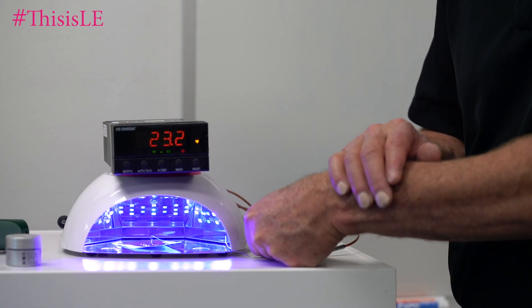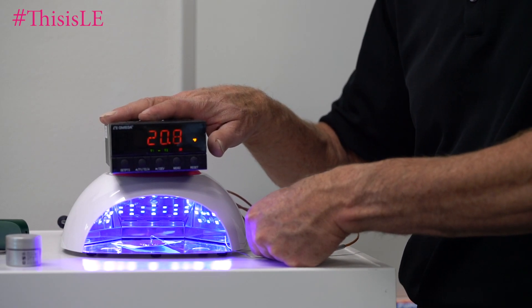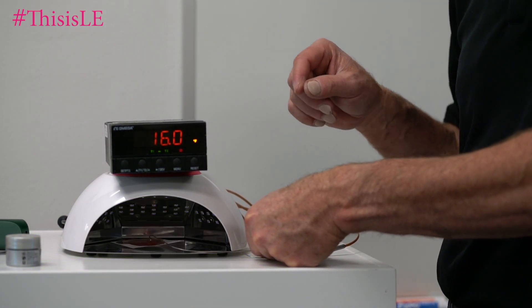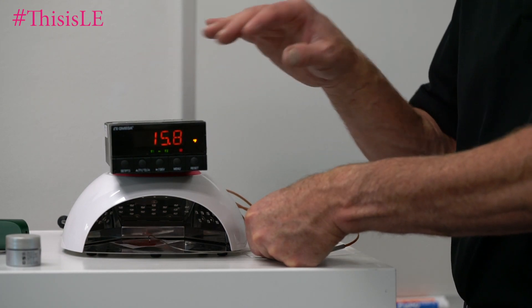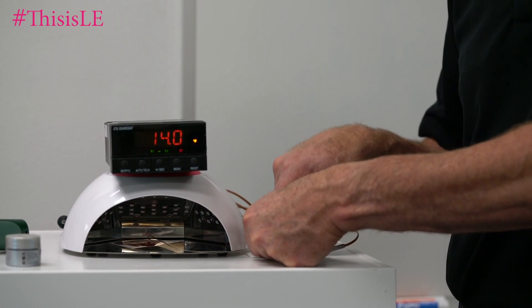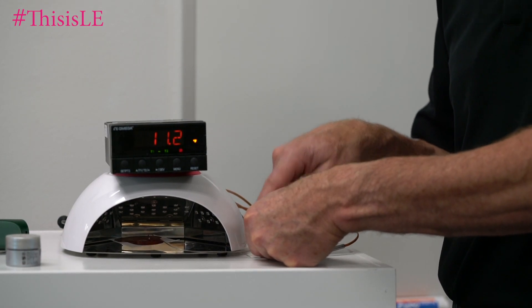You can see it's coming back down again — we've already reached our peak and are dropping back down. You can see the advantage of using a much more expensive type of thermometer so that we can actually measure very quickly the reaction rate. We can even use this to figure out how much of the potential reaction has actually taken place. If we let this whole system equilibrate back down to ambient temperature and then trigger the light on again, if it's cured 100% of the way, we are not going to get any more exothermic reaction coming from the gel.